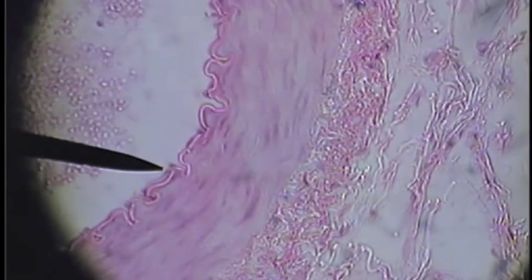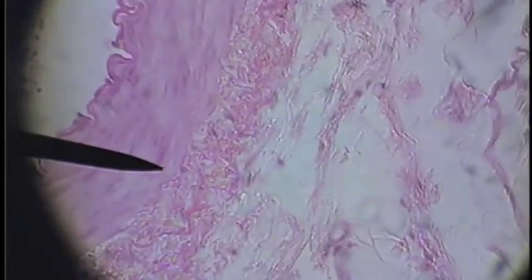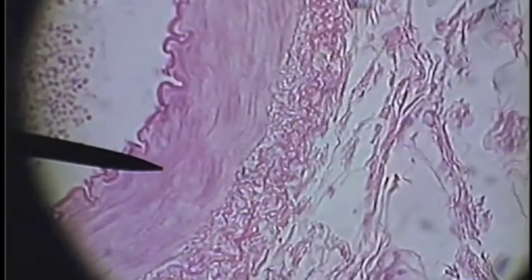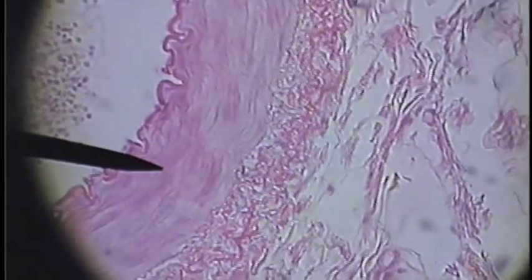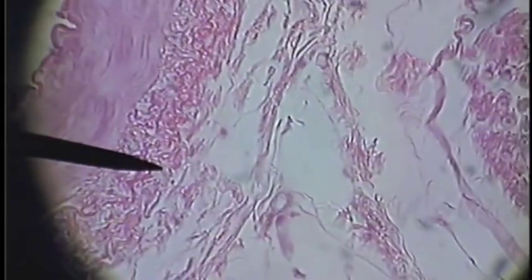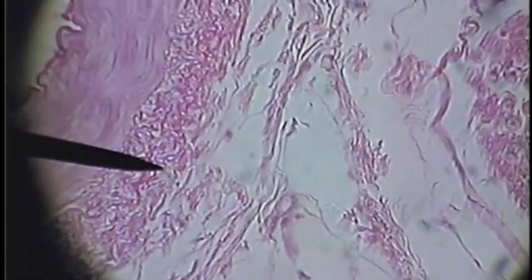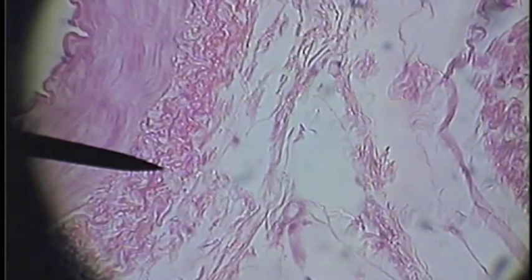So between the elastic membrane and the endothelial cells, we have the tunica interna. Now the pointer is in the tunica media, the smooth muscle layer. External to that we have the tunica externa, which is connective tissue. The pointer is in the connective tissue.